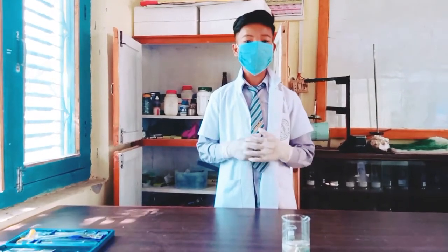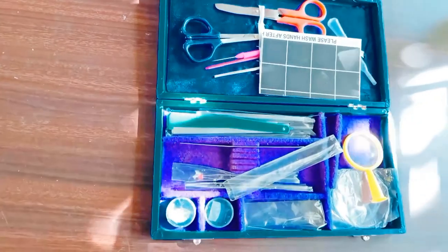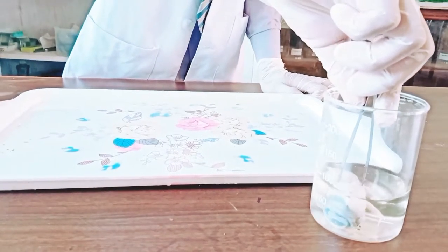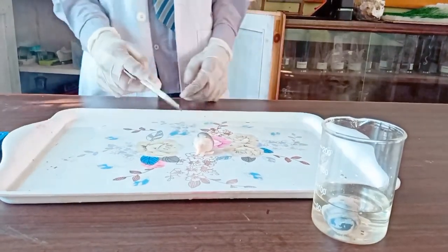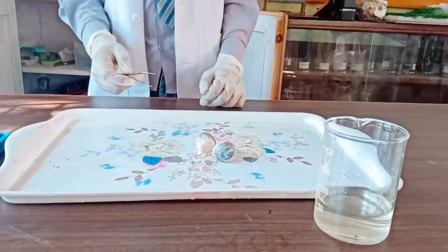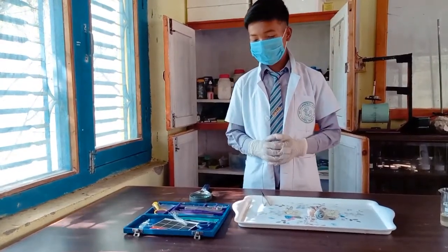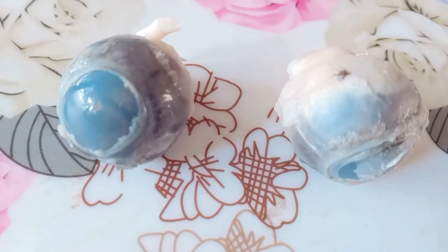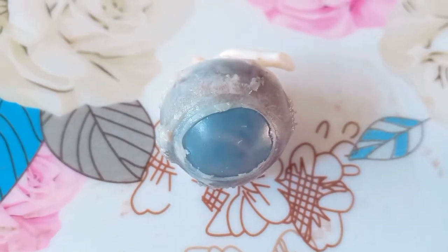Today I have taken the goat eyes and the model eyes. Now I am going to dissect the goat eye to show the different parts. To do this experiment, I have taken the dissection box. This is the goat eye — somewhat spherical, and the front part is slightly bulged.